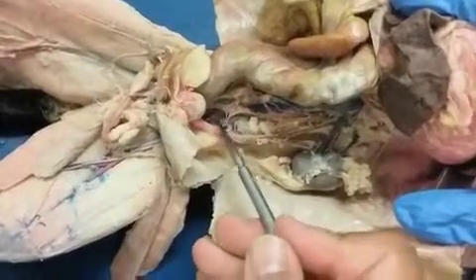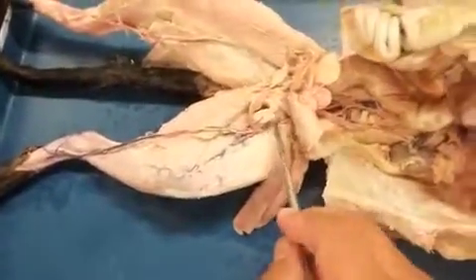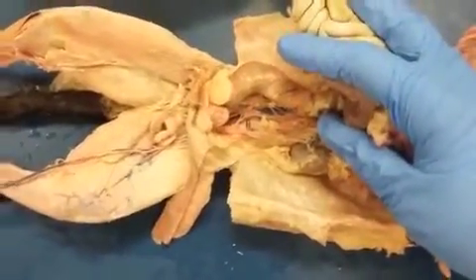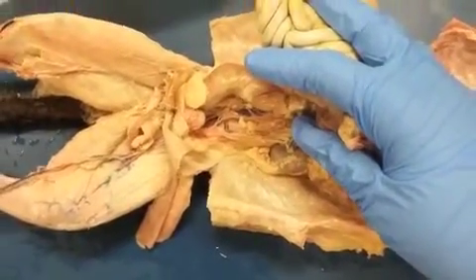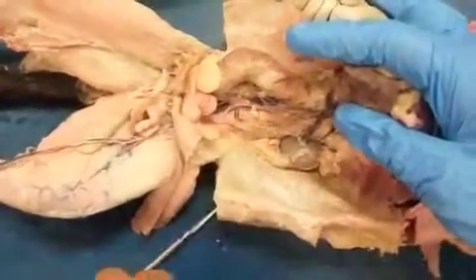Okay. Very small. Yeah. So if you follow the veins back, here's your great saphenous vein, draining into the femoral vein. The femoral vein, as it goes back into the abdominal cavity. Again, this is going to be hard to see because we're going to go back to this region. The femoral vein drains into the external iliac vein. Coming from deep, you have an internal iliac vein. Right? So they form this junction. Those two drain into the common iliac vein, which that one now should be a little more visible.